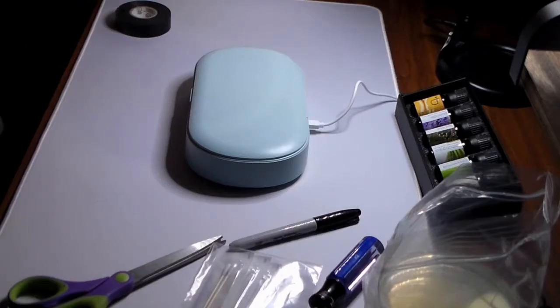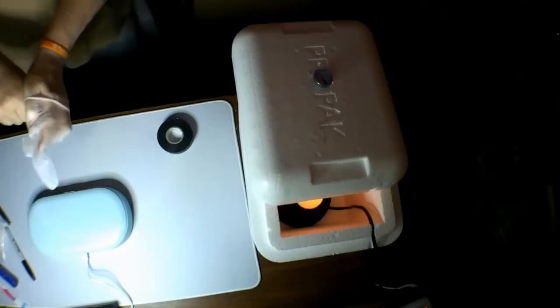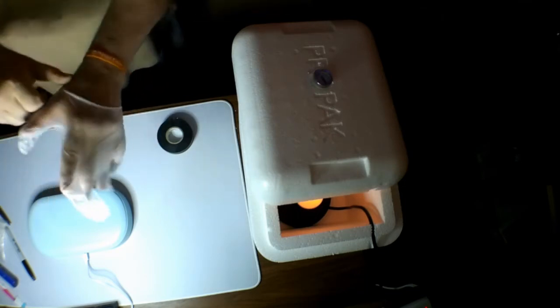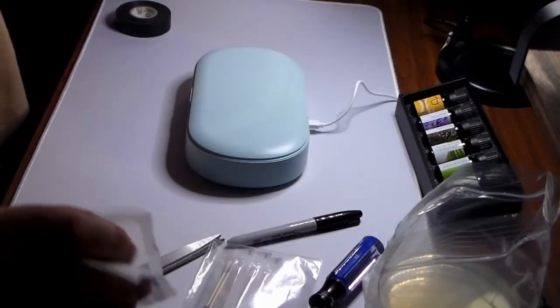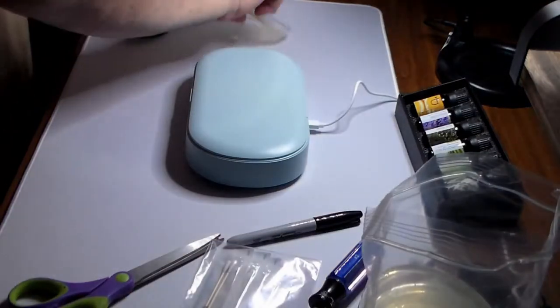Oh, sanitization is complete. Okay, I have some hand sanitizer here. I'm going to put that on my hands before I start anything. So a little bit of hand sanitizer. Let's start there. I don't want to mess this up. Hands are clean. Get a fresh glove. We have our swab, which is moistened with sanitary water.